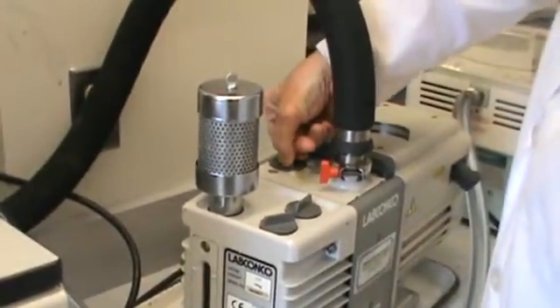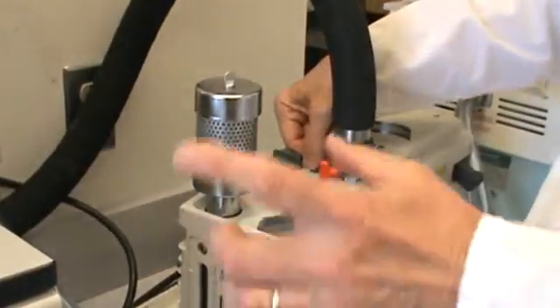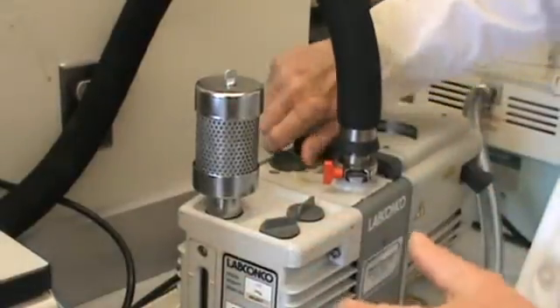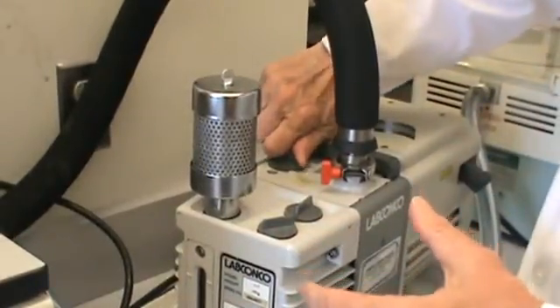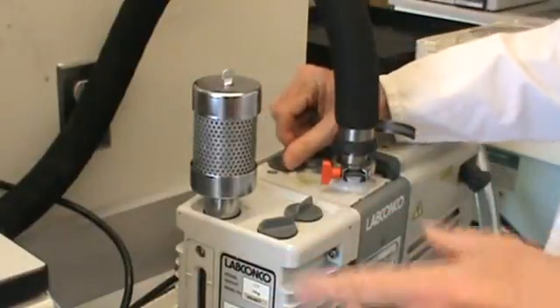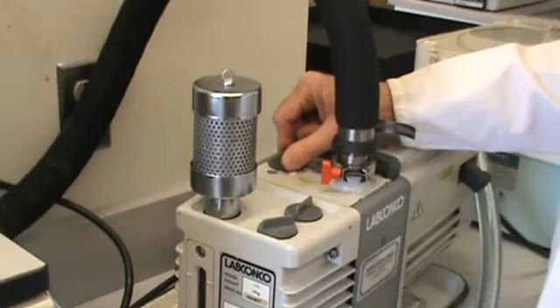This has a fine point gas ballast here which when it's on will let a little bit of air through. Do that for five or fifteen minutes to help dry out the oil. This will help you vacuum a little bit if you do that first. Also afterwards if you think the water got in the oil, you can do that afterwards.